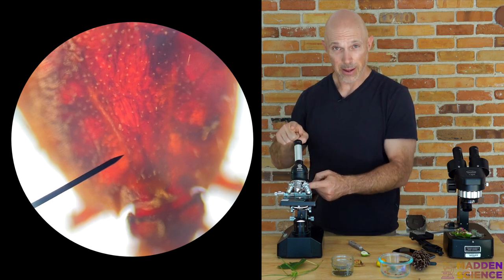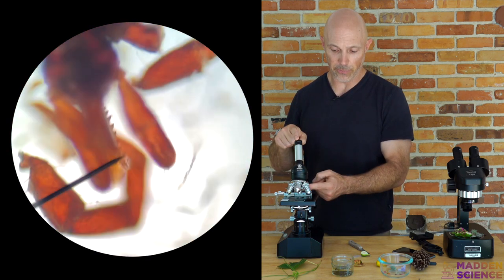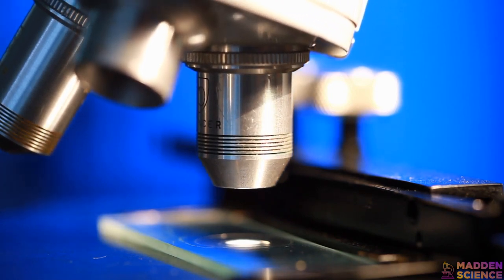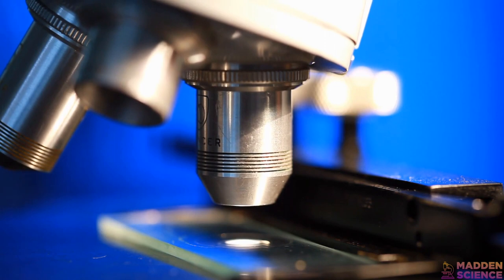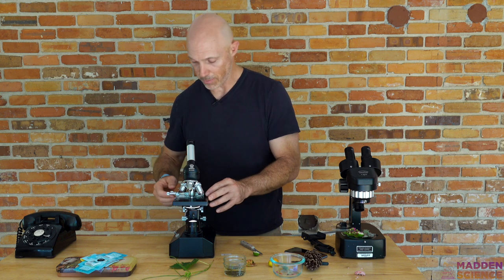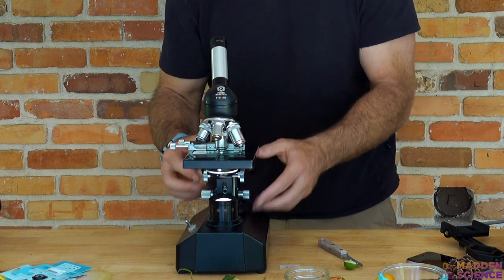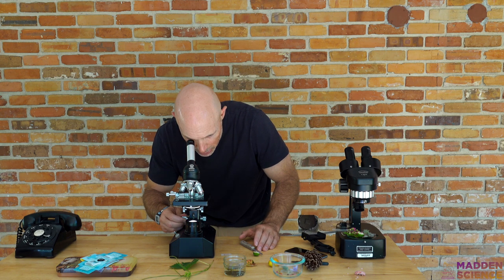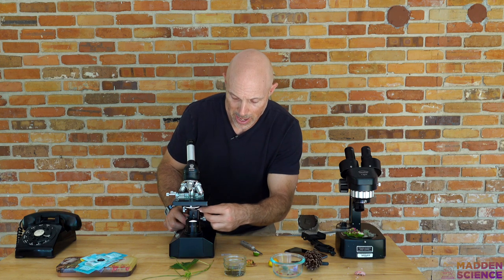Once you have it dialed in — in this case we've got 10x and a 4x — these magnifications can be multiplied, so 10 times 4 is 40. If you're looking at an actual slide, it fits in here and has a holder which allows more precise movements and potentially lets you measure things on your microscope. Once it's already dialed in with coarse adjustment, you can leave it there and just make fine adjustments. Some microscopes underneath have a diaphragm where you can adjust the amount of light that comes in and other tools.